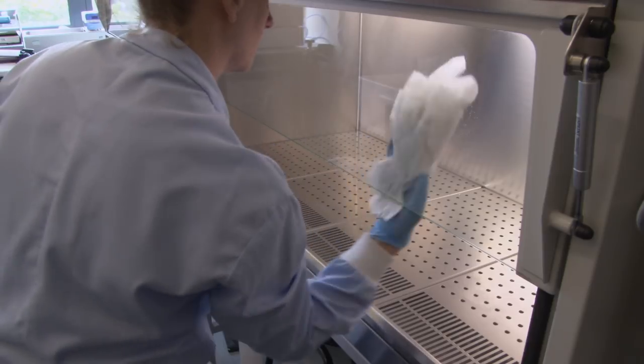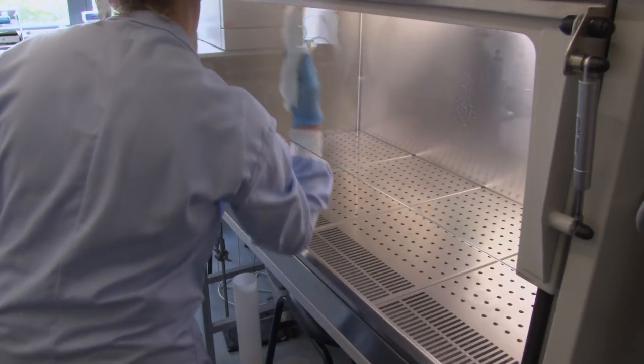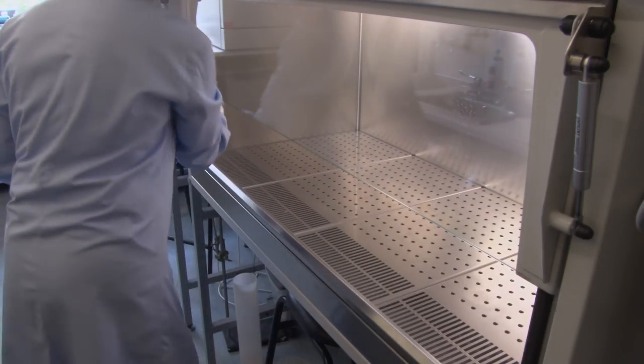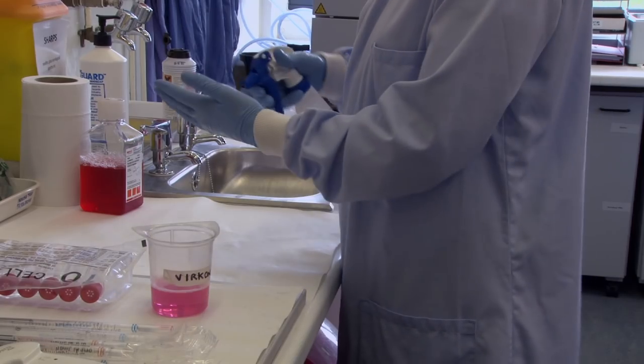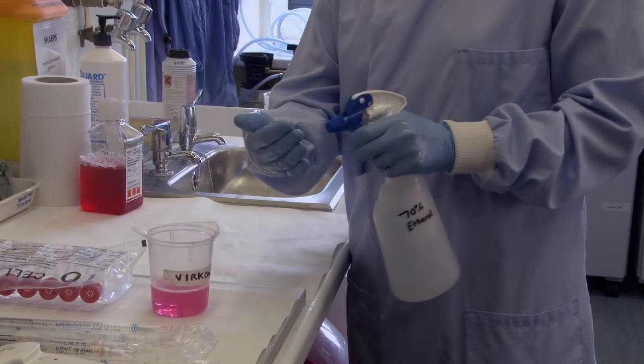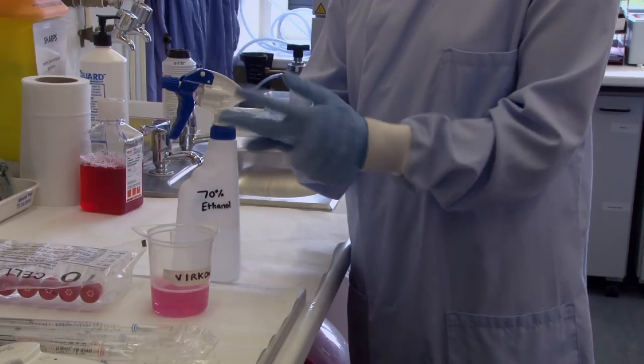Once the inside is clean you begin preparing all of the equipment you're going to use. Put on a pair of gloves and sterilize them by spraying generously with ethanol. Make sure the entire surface of the gloves are covered.